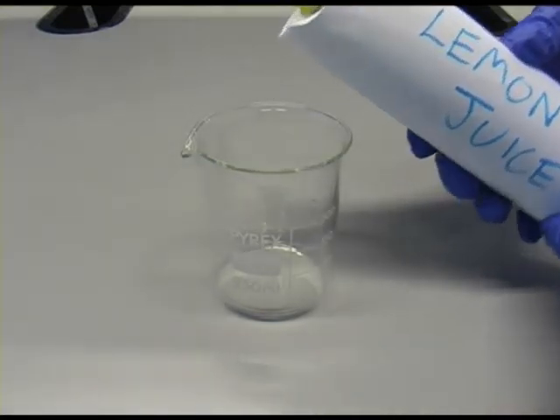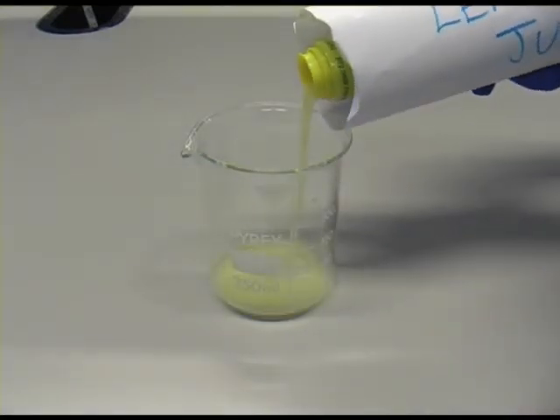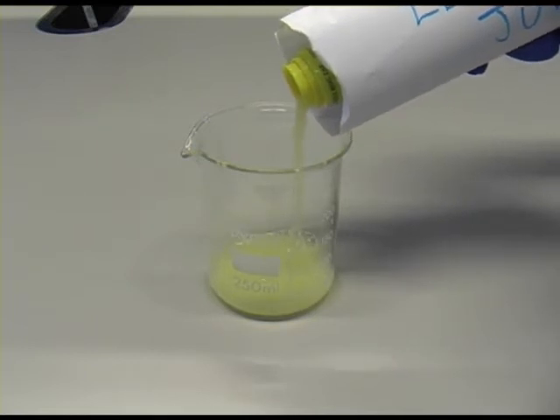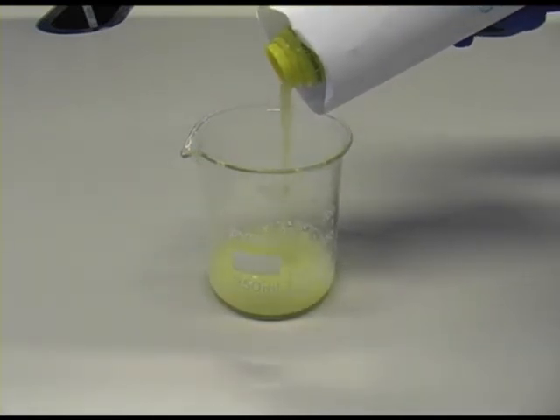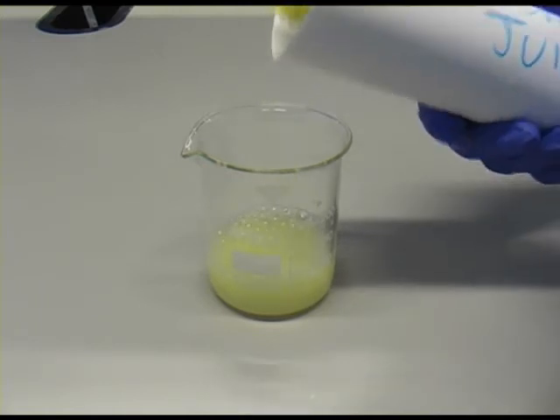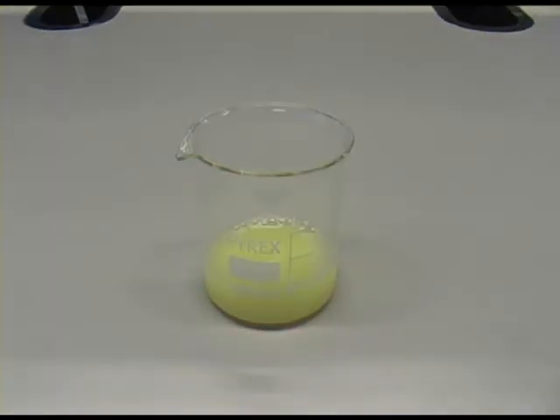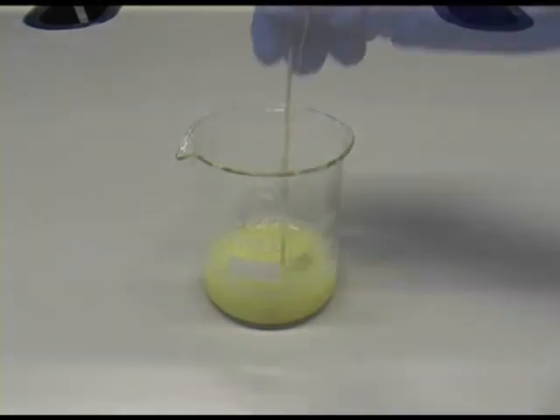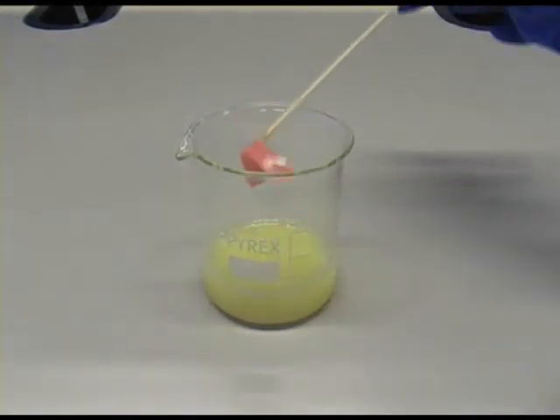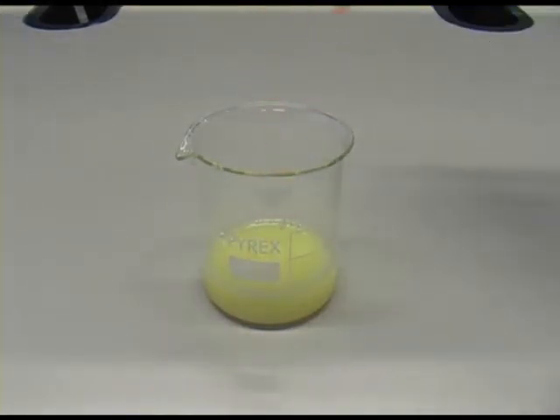Now let's try some lemon juice. Again, do you think this will be acid or alkali? Let's pop in some blue litmus paper. And after a good stirring, you'll see that the blue litmus comes out red, indicating lemon juice is also an acid.